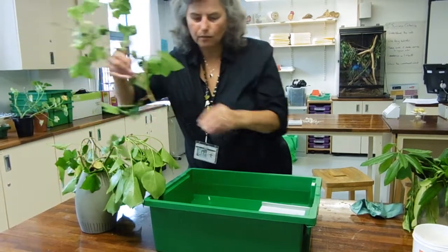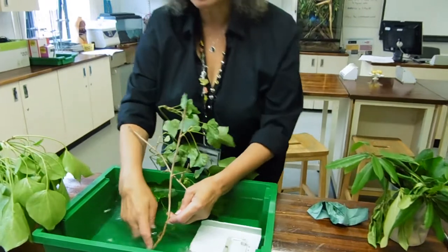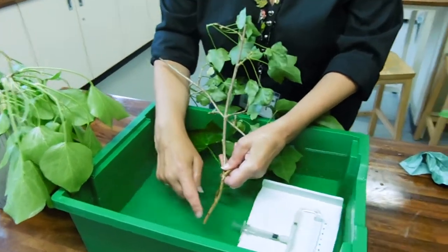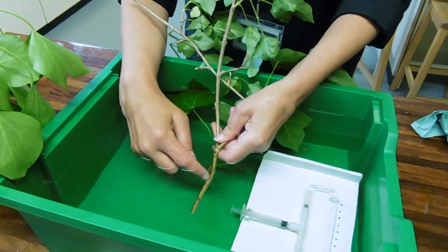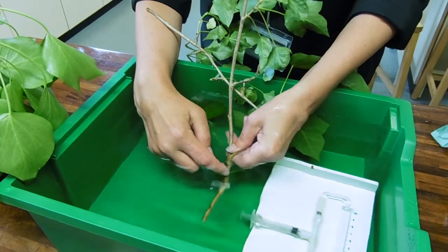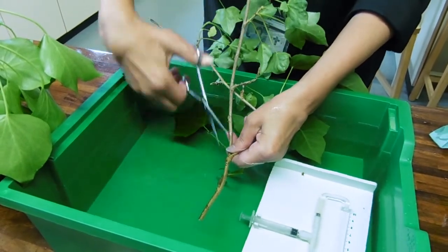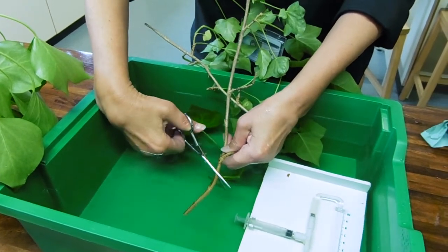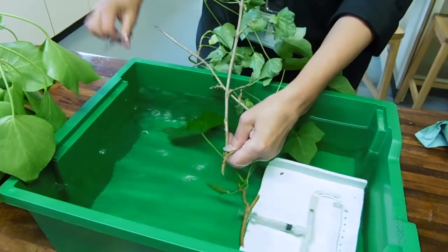I'm doing it that way, but what I'm going to do is assume that because I've broken the tension in the column — cohesion-tension theory — the air will have pinged up to about here, and I'm going to cut it about there. I've got some little scissors but I might need to borrow Dr Saville's really big scissors. Oh look at me, how strong am I?